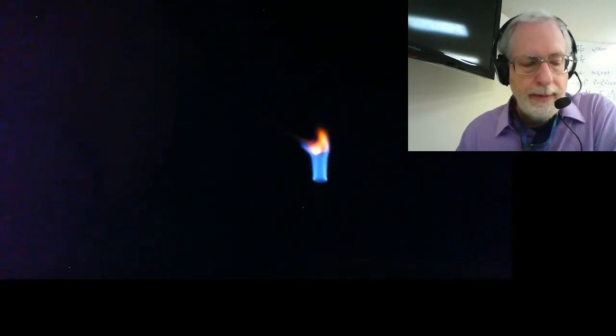Then we go to calcium chloride. Keep going, calcium chloride solutions. So calcium chloride, I'll be straight up with you, it's very similar to strontium chloride, but it has usually a little more towards the orange side, and strontium chloride is usually a little bit towards the red side.